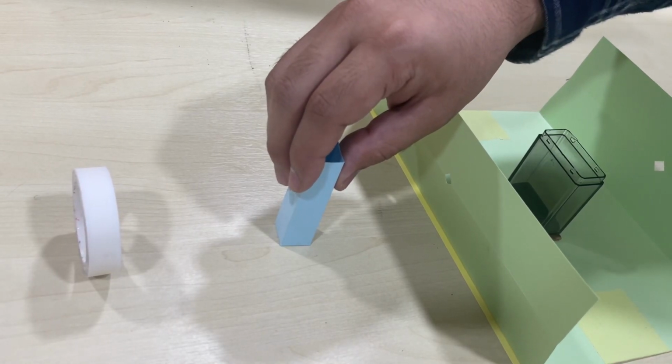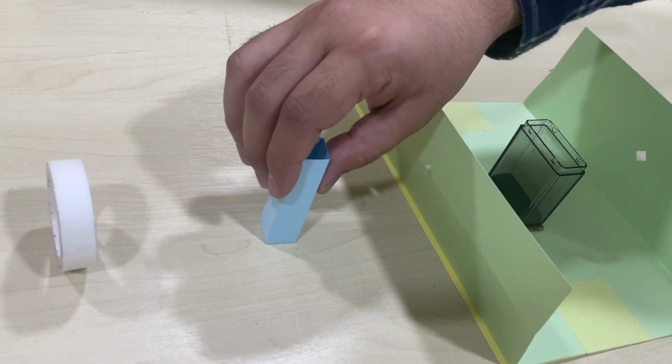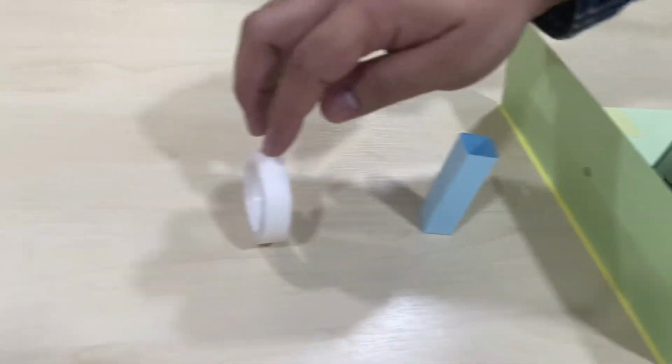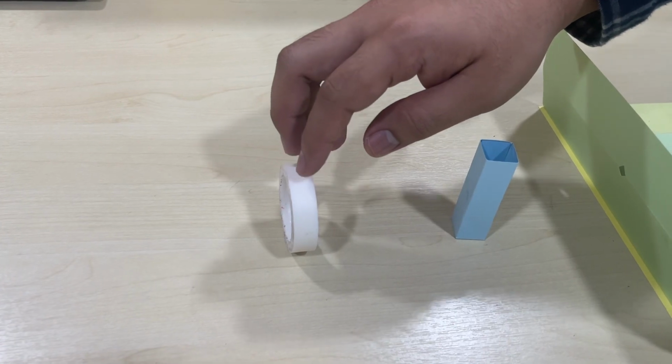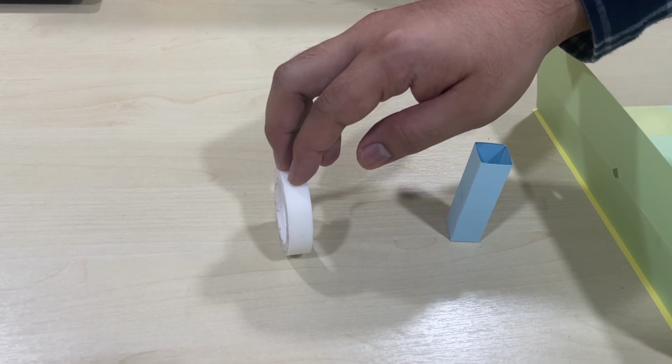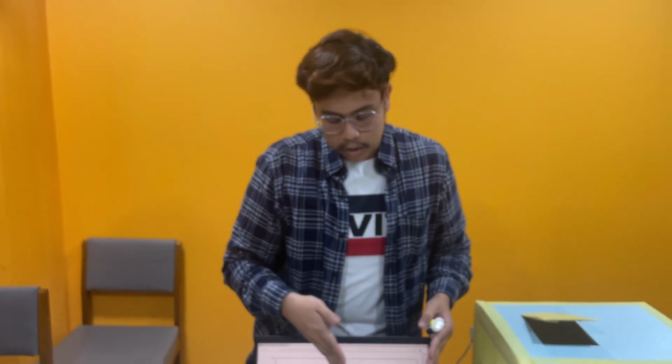And from the sample cell, it will absorb some of the wavelength and then transmit the rest into the photomultiplier tube, or our detector, that will convert the wavelength into an electrical signal, and from the electrical signal our readout device will read and give out our spectrum.